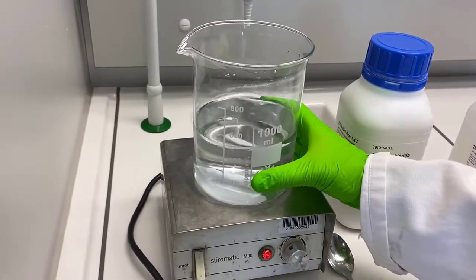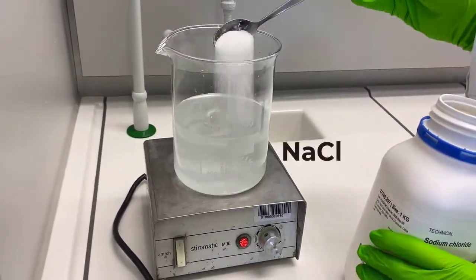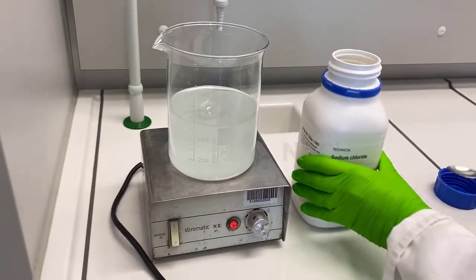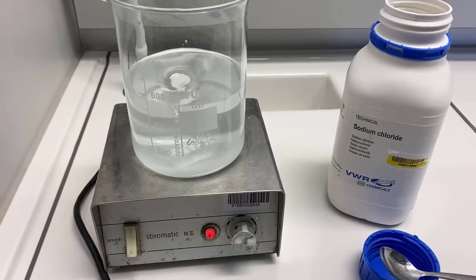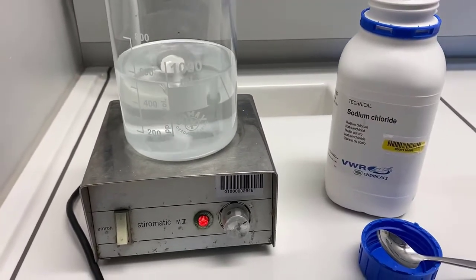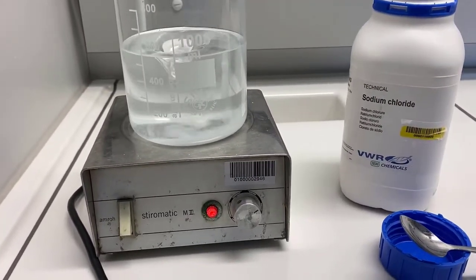The next step is to dissolve sodium chloride in this solution. Sodium chloride should be added in intervals until no further salt is dissolving anymore in the solution. This might take a few hours, say an hour or two.